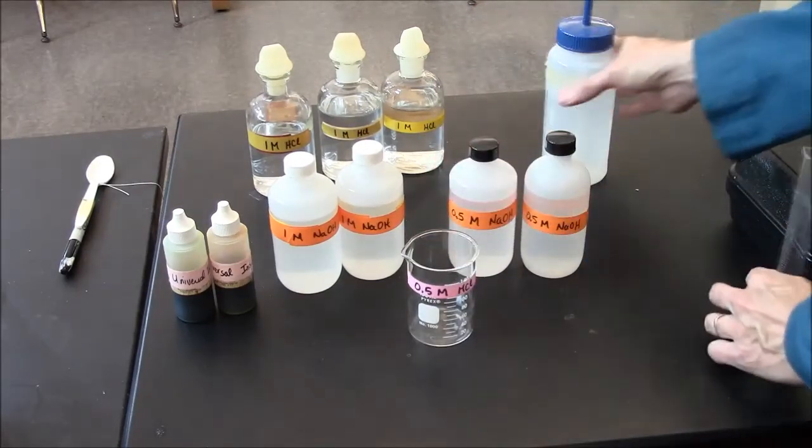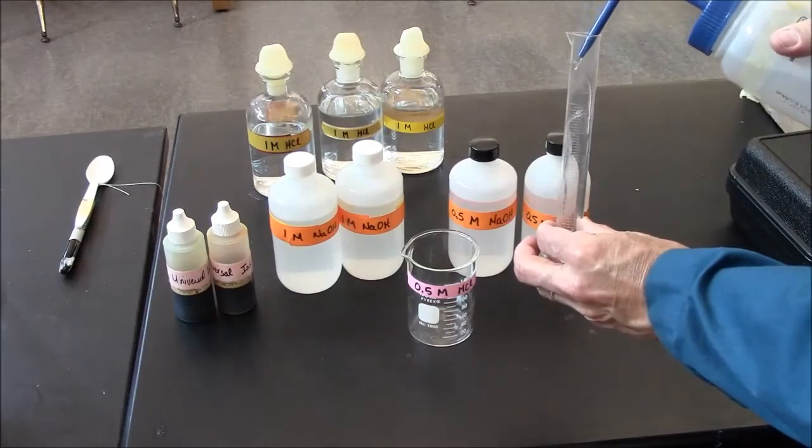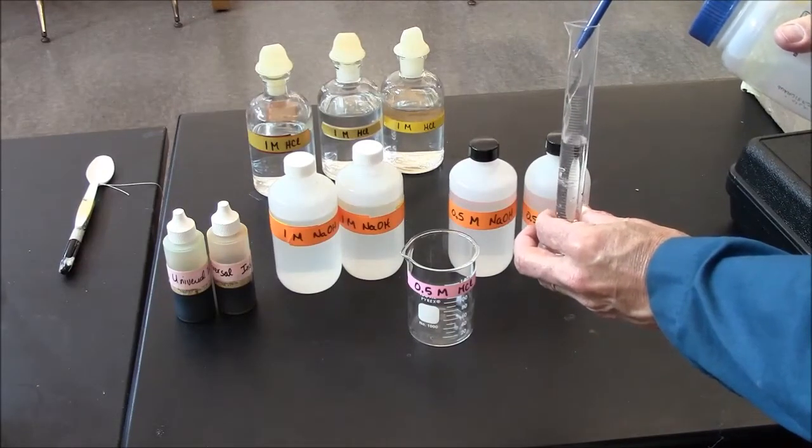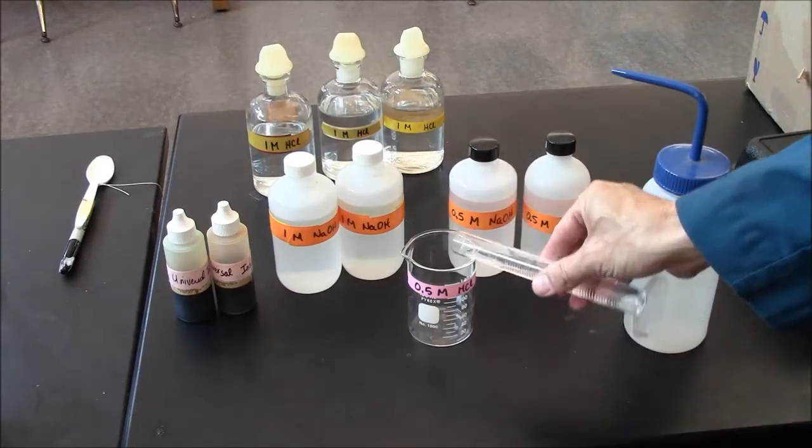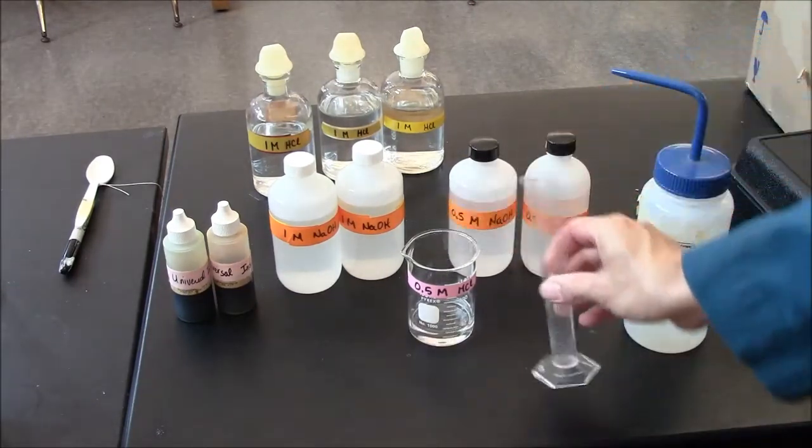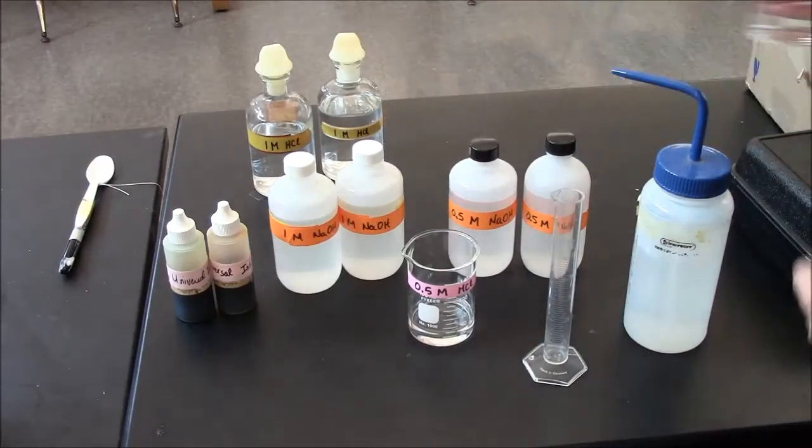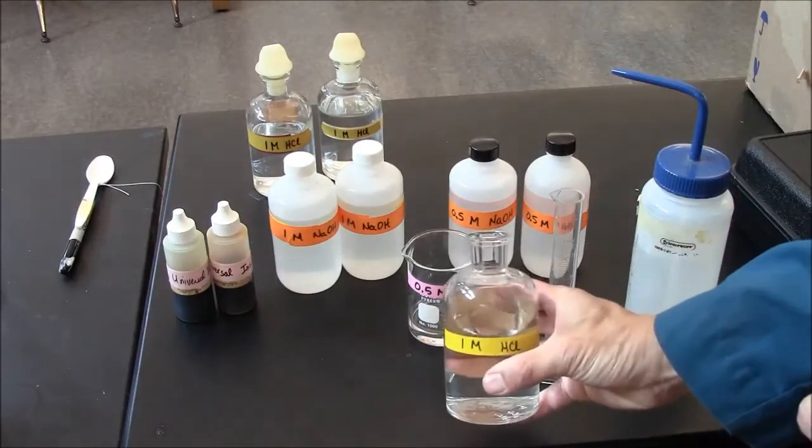You would take a volume of water, perhaps 25 milliliters, distilled water. You would take 25 milliliters of one molar HCl.